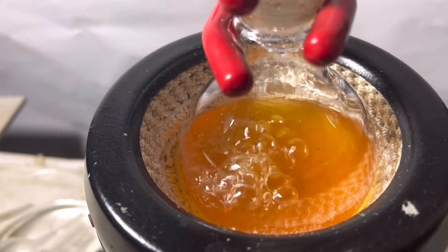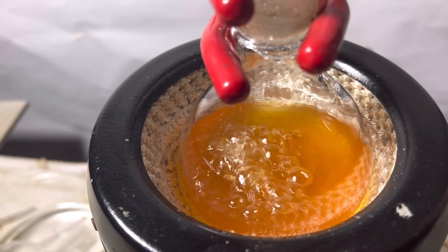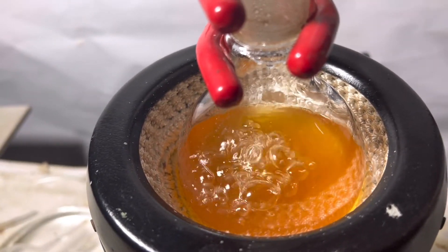The residue in the flask contains sodium bromide and some unreacted sodium cyanide and high boiling byproducts.